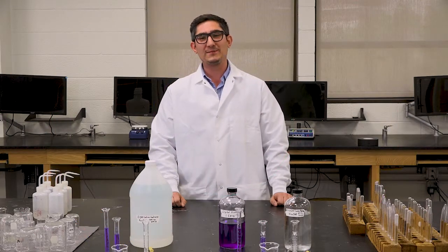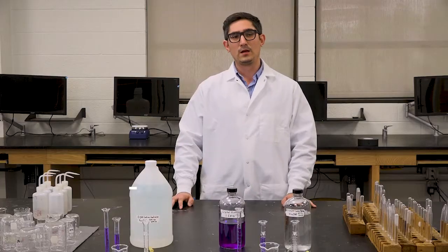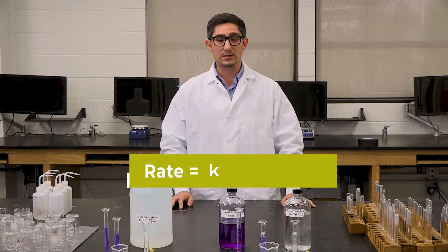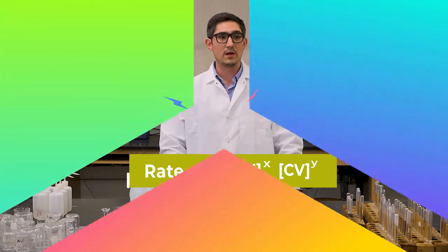Today we're going to be using the microlab as a spectrophotometer to monitor the changes in crystal violet over time. We're going to be tracking the crystal violet still in solution, and so to do this we need to come up with a rate constant, or a rate law. So for the rate law, what we're going to be incorporating is, of course, the rate constant, the concentration of hydroxide in solution, as well as the concentration of crystal violet in solution. The hydroxide will be raised to the reactant order X, and the crystal violet concentration will be raised to the exponent Y, which is just the individual reactant orders.